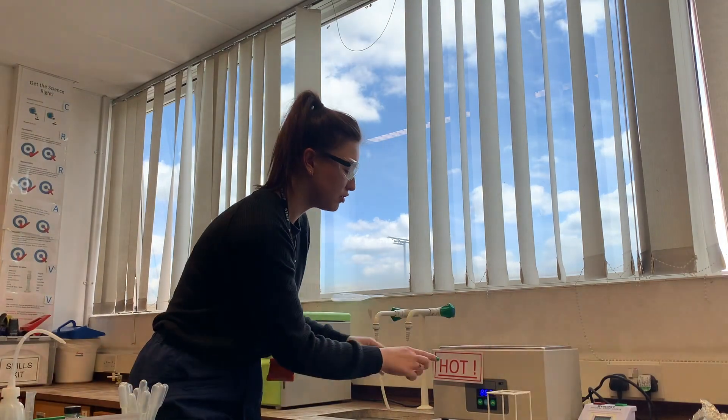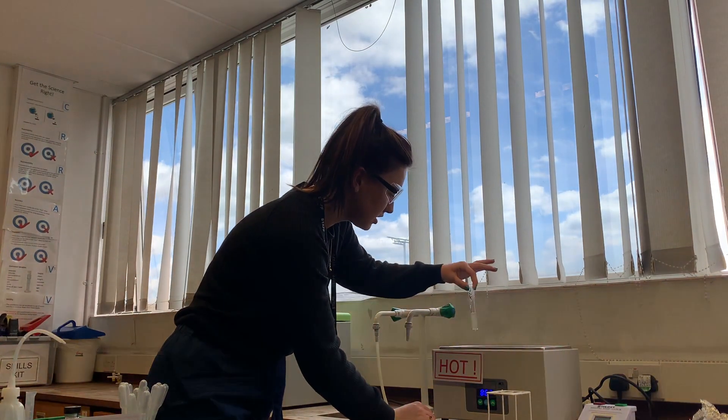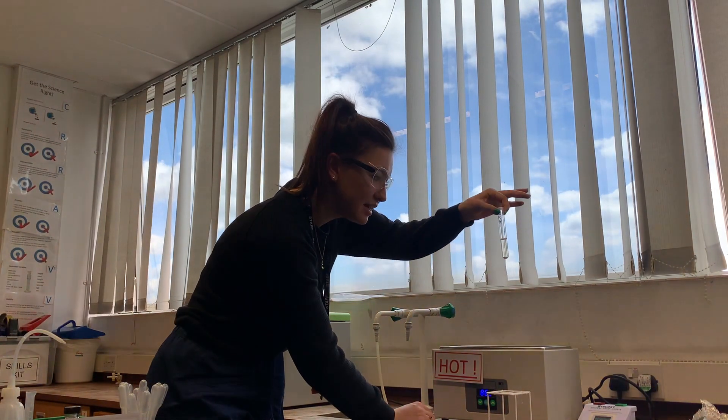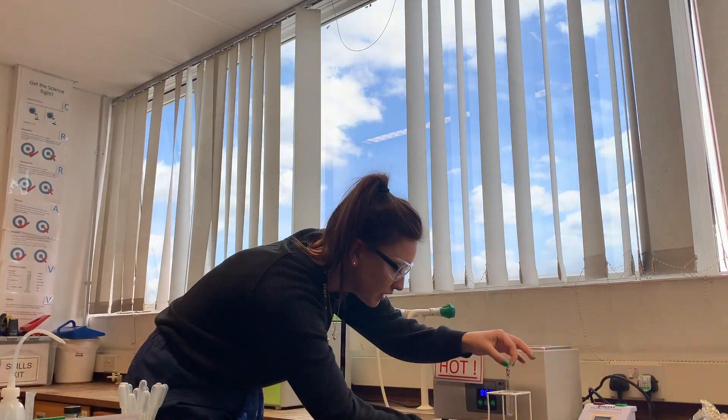15 minutes has passed, so we're going to take out the test tubes from the water bath - just be careful because it's really hot. You can see we've got a nice color change; this is no longer blue.